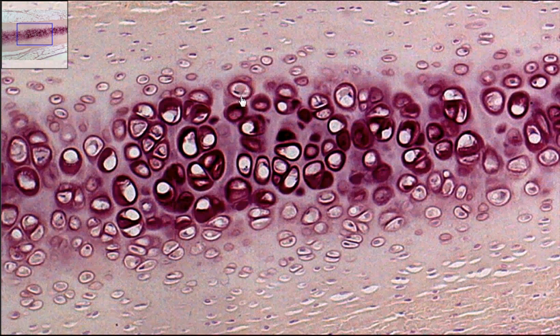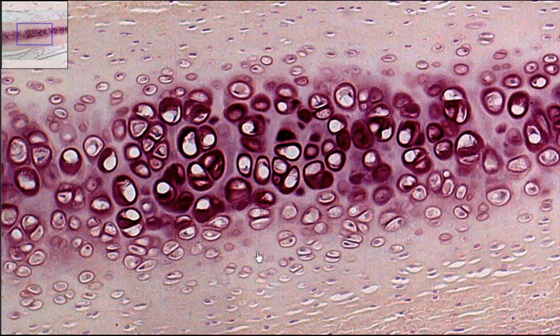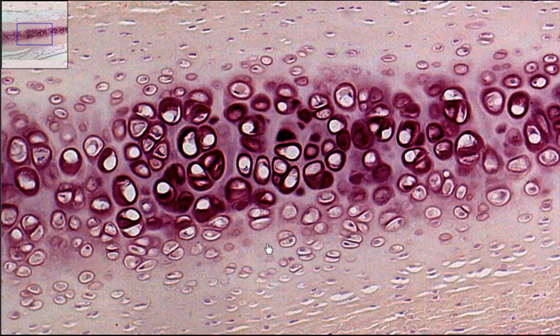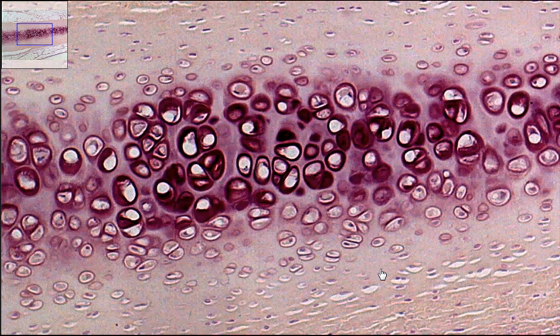So we have our cells. The space in between the lacuna is the extracellular matrix. In hyaline cartilage, a lot of times you do not see the fibers because they're within the extracellular matrix — they're there, just not visible from the staining.